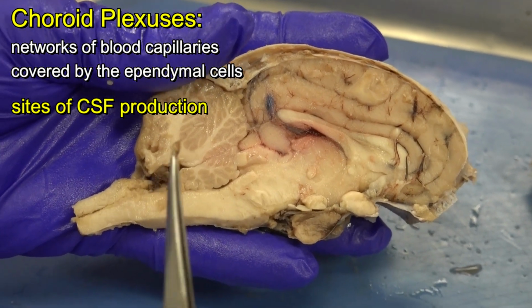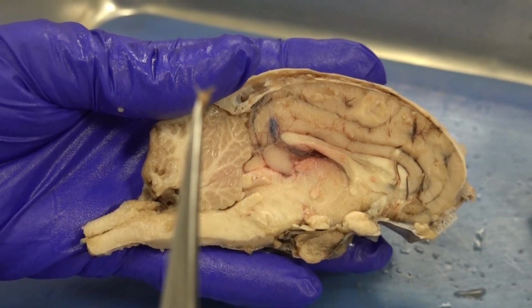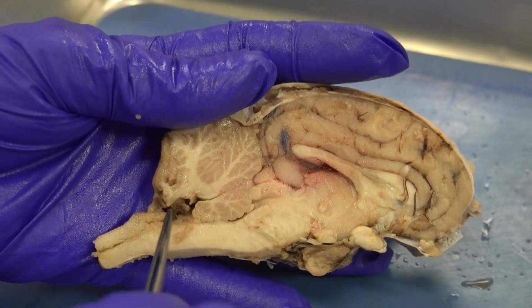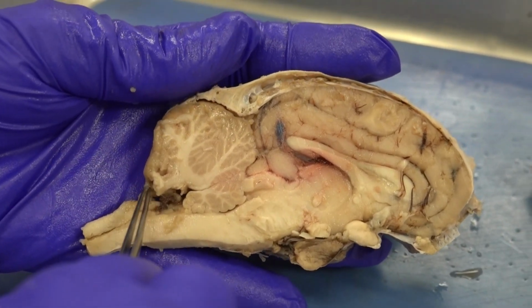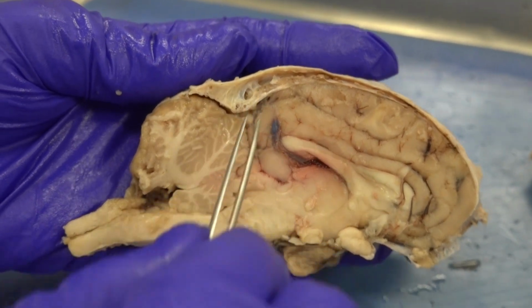So inside the ventricles of the brain, we find choroid plexuses. Right now, I'm holding a small piece of one choroid plexus inside the fourth ventricle. Please keep in mind, from the fourth ventricle, the cerebrospinal fluid flows into the central canal of the spinal cord and also flows into the subarachnoid spaces that we have in the brain and spinal cord.